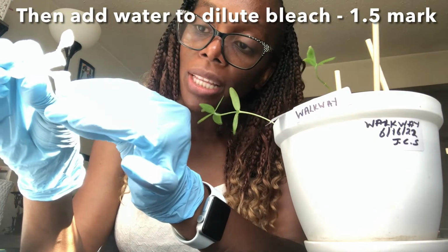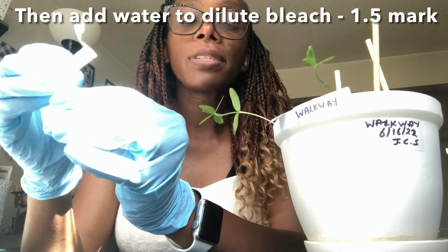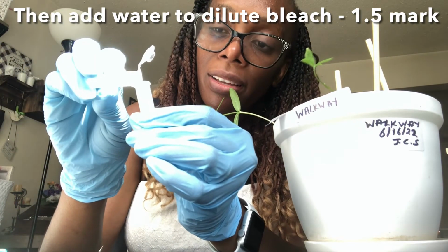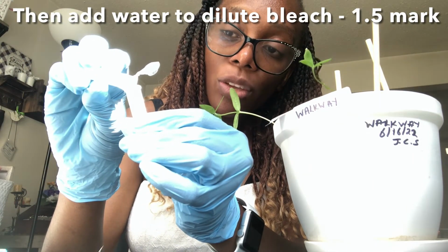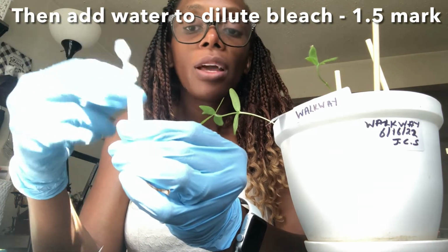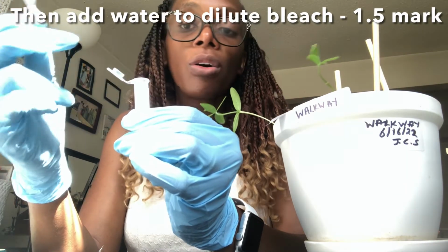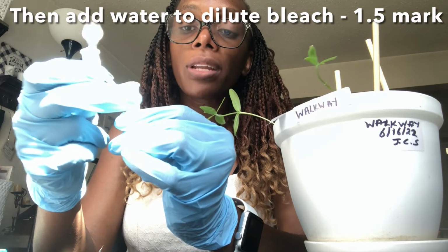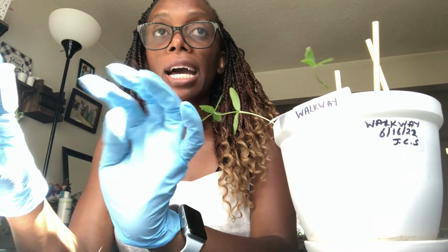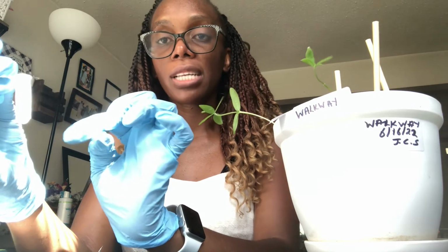So I am going to put this to the, actually in this case, because mine is like 8%, I'll put this to the 1.5 mark. Okay, so remember that for everything that you do, however many drops you add, the volume that you use, whether it's 1.0 mL or 1.5 mL, depending on where the level was at, you have to indicate that in your eLab notebook. So if you're on the high concentration, add more water, and if you're on the low concentration, you obviously add less water.